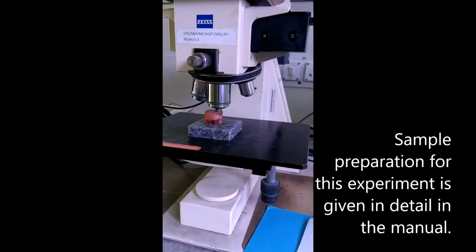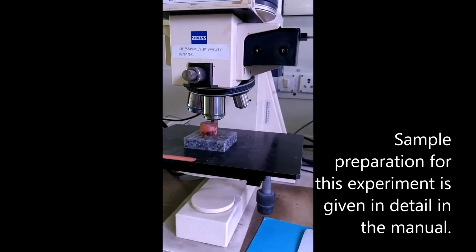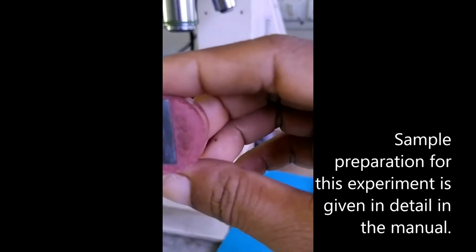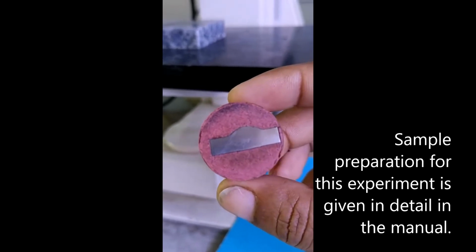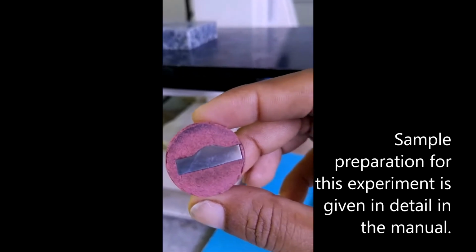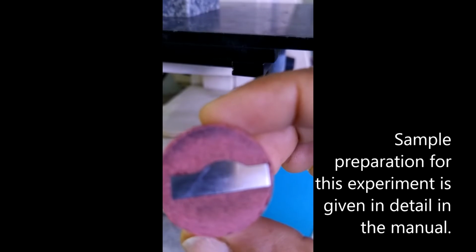Now, our another experiment is the study of the affected zone in a welded sample of low carbon steel. So for this, this is our sample. This is our welded sample. So we can see, in this sample, during the welding process or due to the heat of the welding torch, some grains may change their structure.